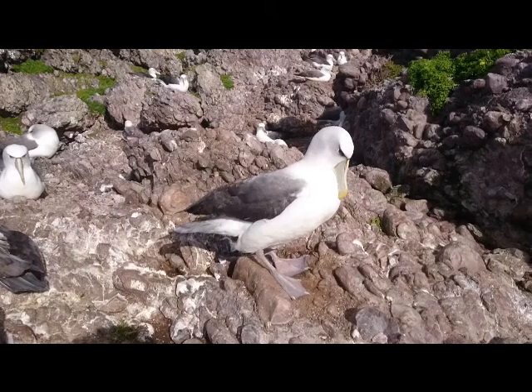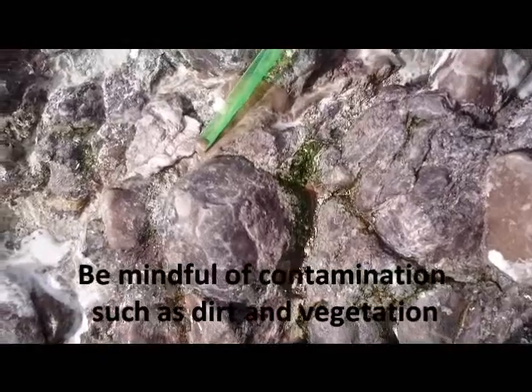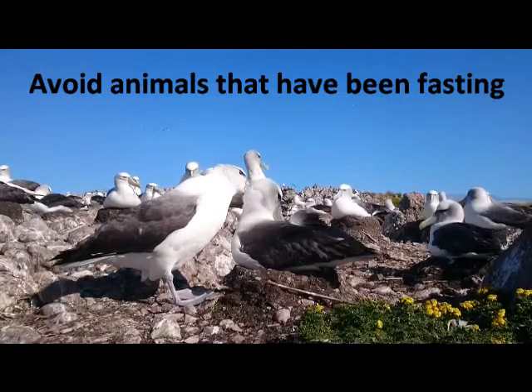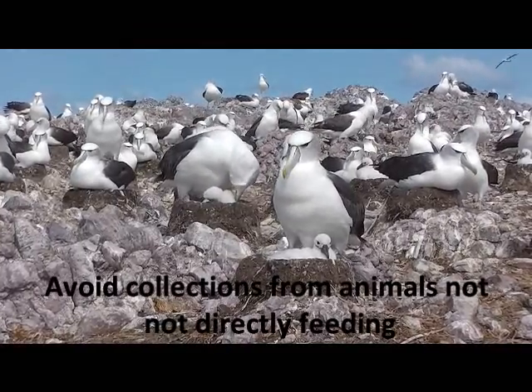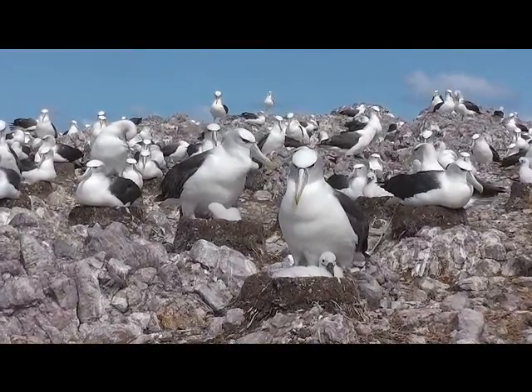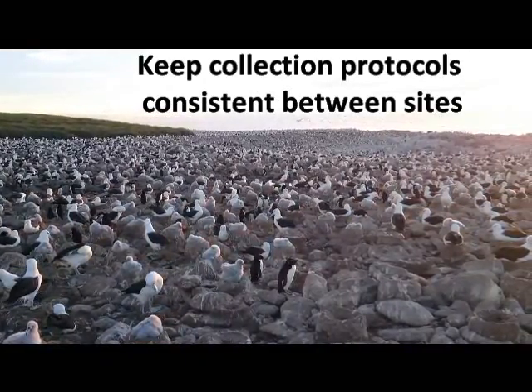In summary, to get high quality dietary data from scat samples, try to collect fresh scats when the animal is seen defecating. Otherwise target wet samples. Be mindful of contamination and minimise the collection of dirt or vegetation in the sample. Collect scats from animals with minimal time since feeding and avoid fasting animals. Avoid young animals that have not fed directly themselves, for example those fed by regurgitation, or instead target larger, older individuals or adults. And finally, keep collection protocols consistent between sites so that dietary data is comparable.